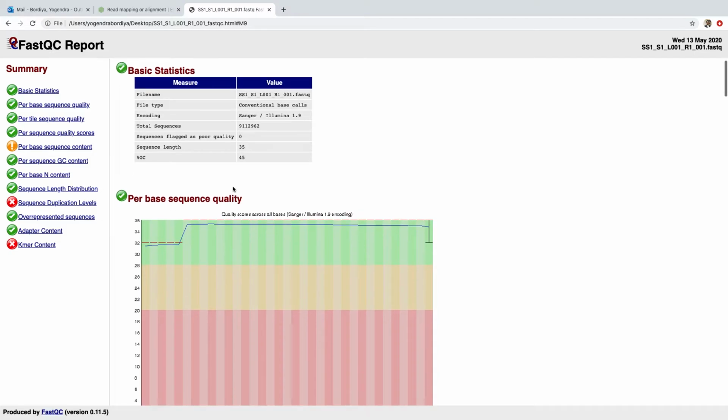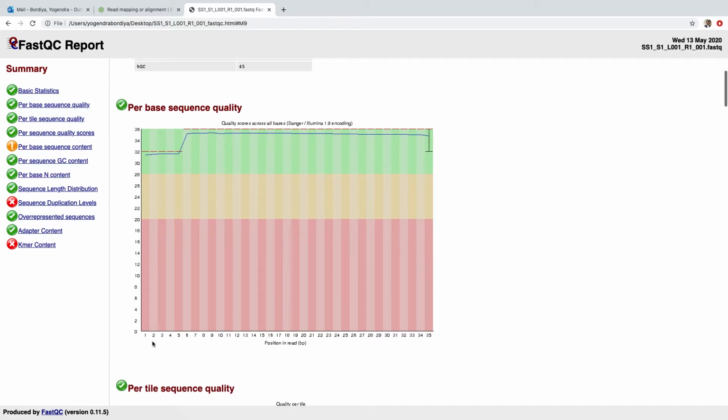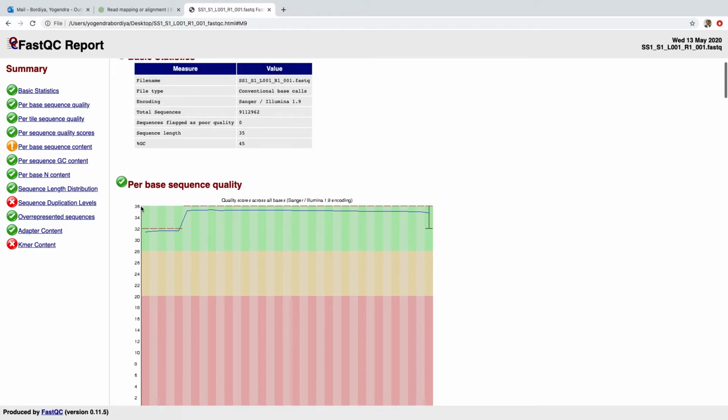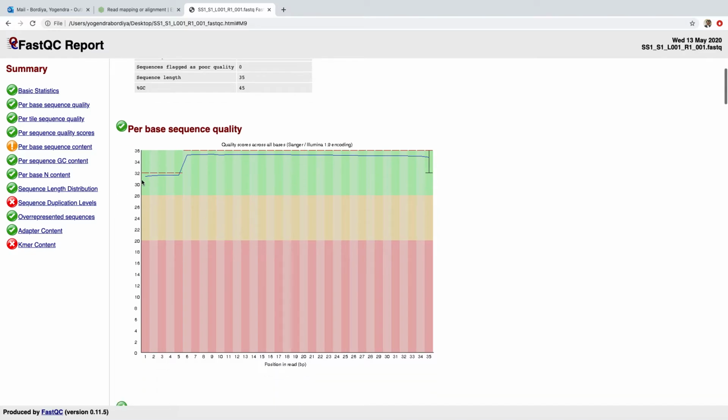So here there are a number of statistics. So there is a summary of all the quality control. And the first thing you see is this graph, where on x-axis you have the position in the read in terms of base pairs. So I have 35 base pairs. And the y-axis is the quality score, which ranges from 0 to 36 in this case. Anything above 30 is considered as good quality. So in this particular file, pretty much all of the bases have a score of 32 or above.